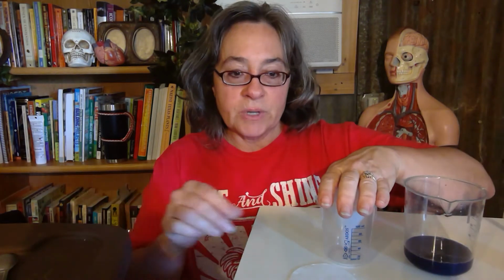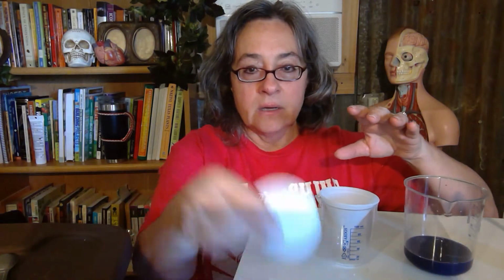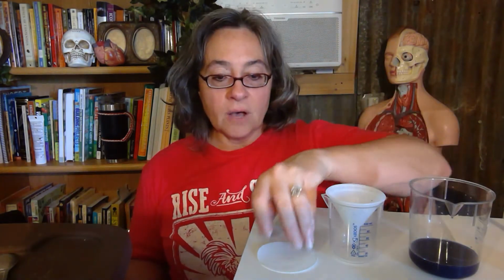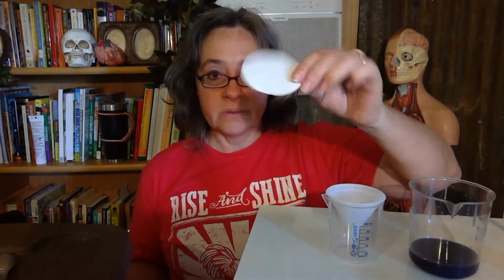So here's beaker 1, here is the filter paper, and then beaker 2. We can go ahead and fill in a couple of columns now. Go to your Google slide. The first column says contents of urinary organs. These are our, quote, urinary organs. Beaker 1 is empty, so write the word empty. The filter paper, there's nothing on there, so put empty.